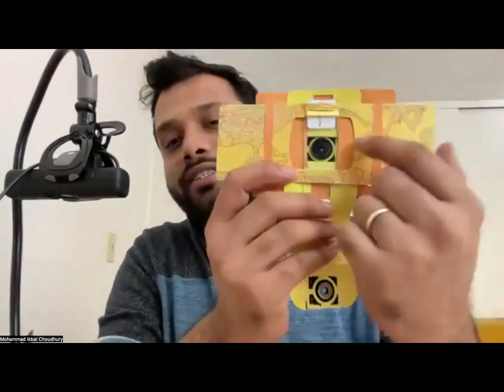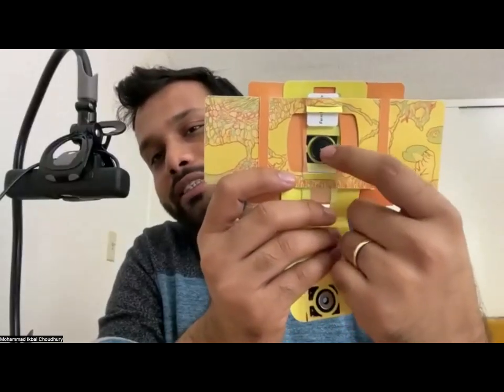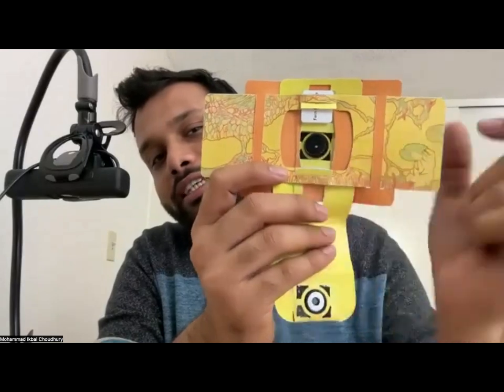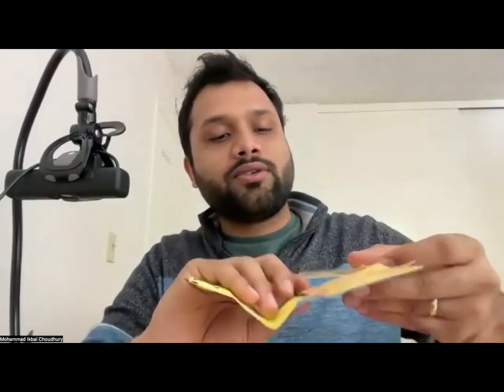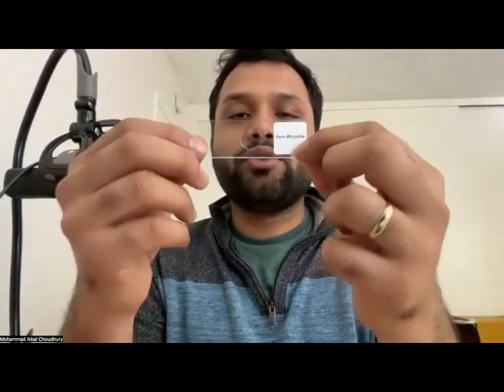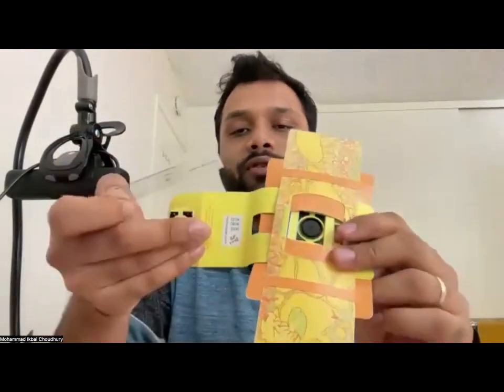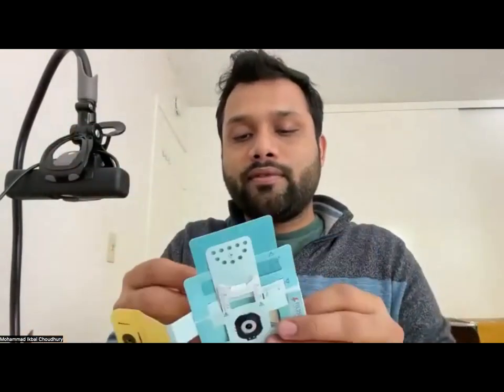Okay, I found the reason why I'm not able to visualize: the sample is not towards the lens, it's away from the lens. I can hold the glass slide. As I said, the sample side of the glass slide needs to be towards the lens. Essentially you should be able to read the label. If you have a label on your sample, the label should be away from you, towards the lens, as you are setting it up on the foldscope. Maybe that's it. Try that.